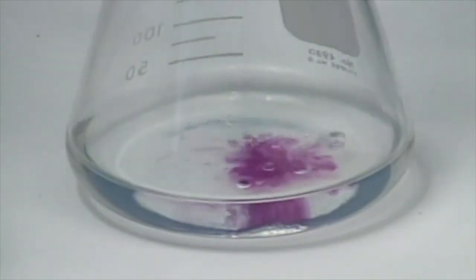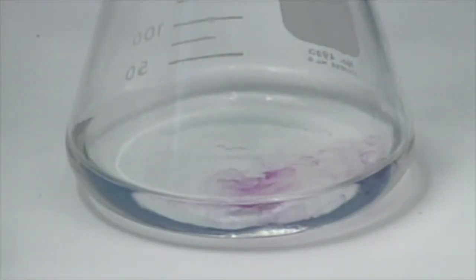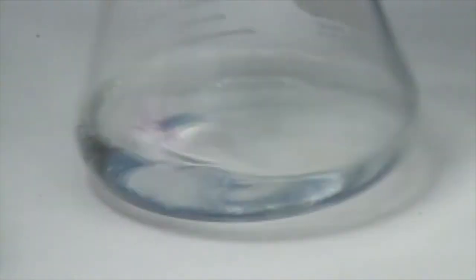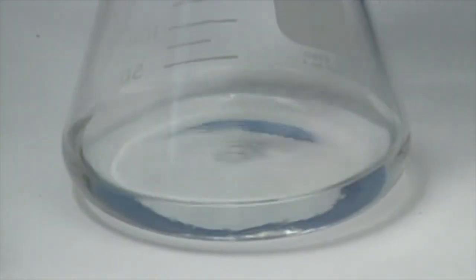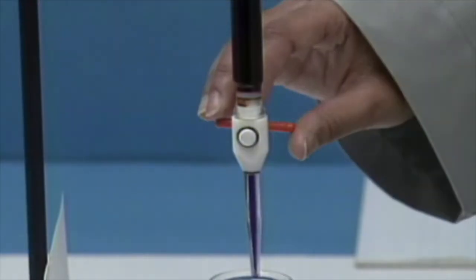At this stage, all of the added titrant has reacted within the flask. We know this because the solution in the flask has reverted back to being clear and colorless.